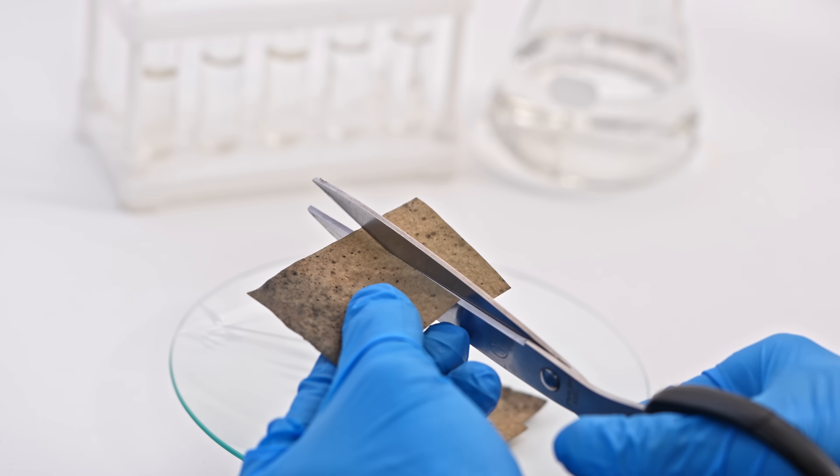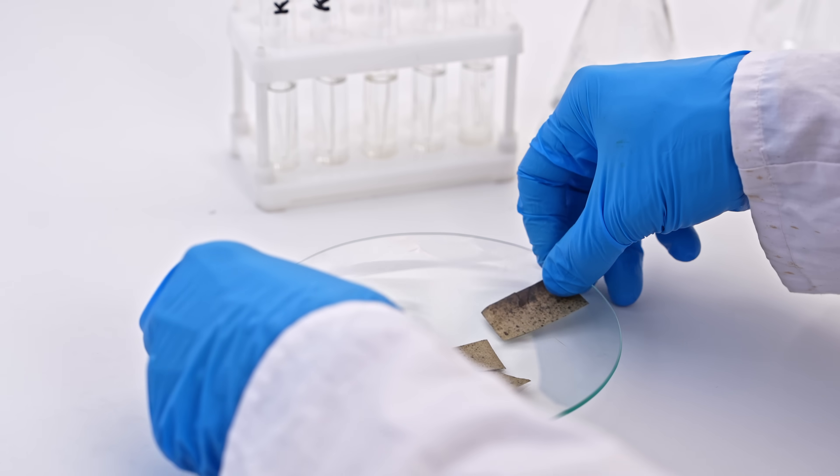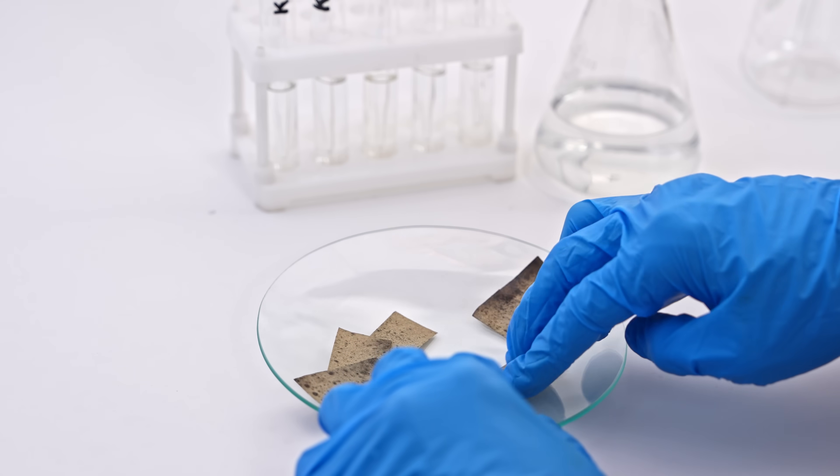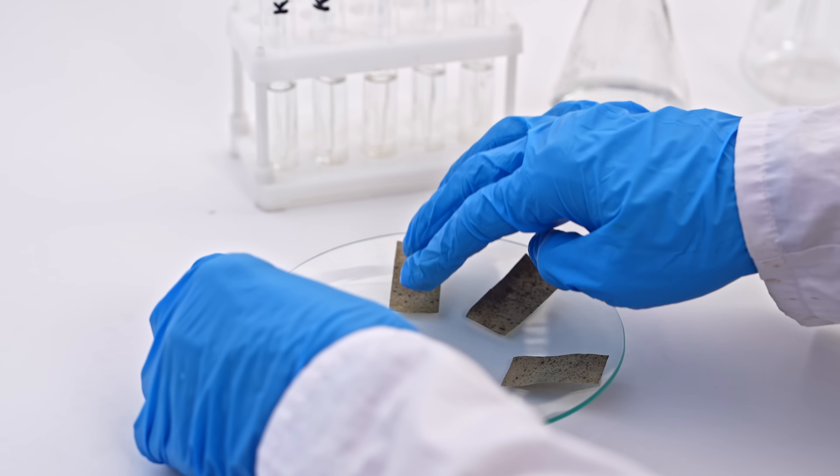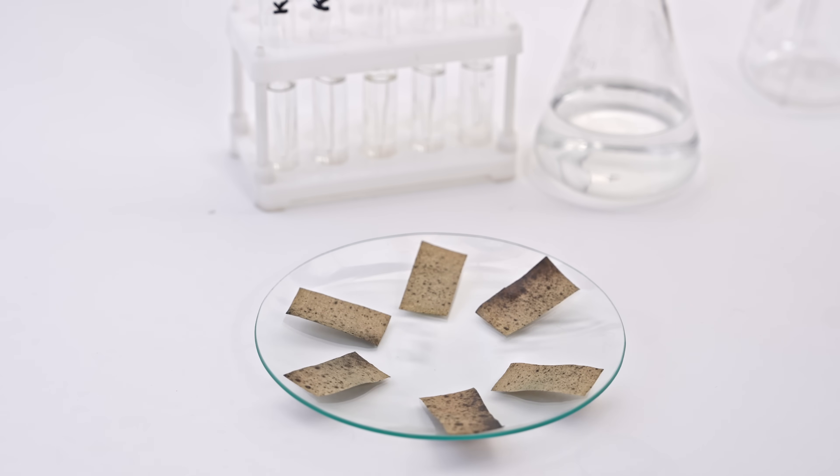So, how does it work? This is a fairly selective reaction for cyanide ions. If we place a drop of cyanide solution on the brown paper, the cyanide ions dissolve the brown color, leaving the paper white. This reaction confirms the presence of cyanide.